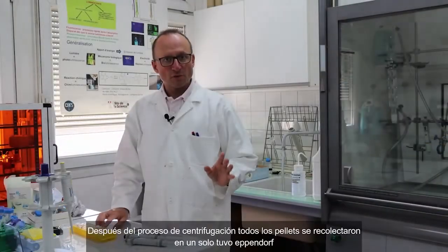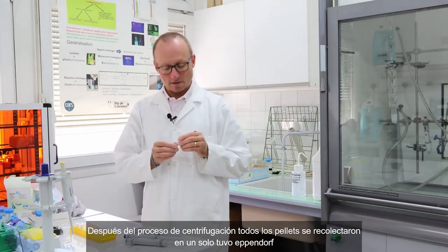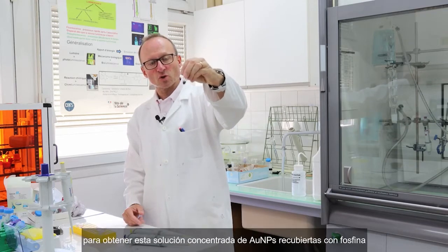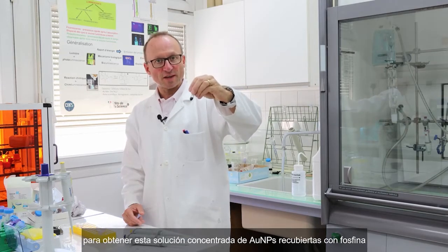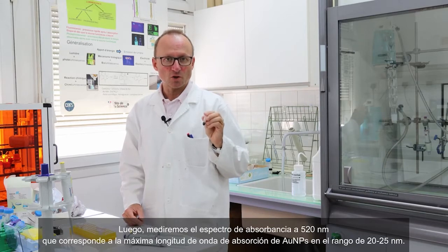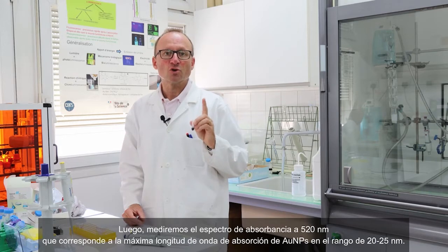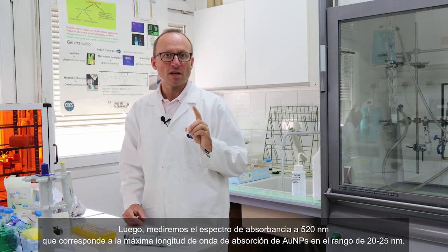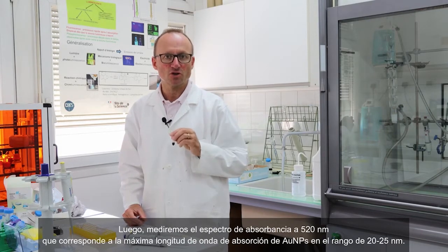After centrifugation, all the samples are gathered together into one single tube, to give this very concentrated solution containing the gold nanoparticles covered with the phosphine. Then we have to record the absorbance of this solution, and more specifically the absorbance at 520 nanometers, which is usually the maximum wavelength for the absorbance of gold nanoparticles in the range of 20-25 nanometers in size.